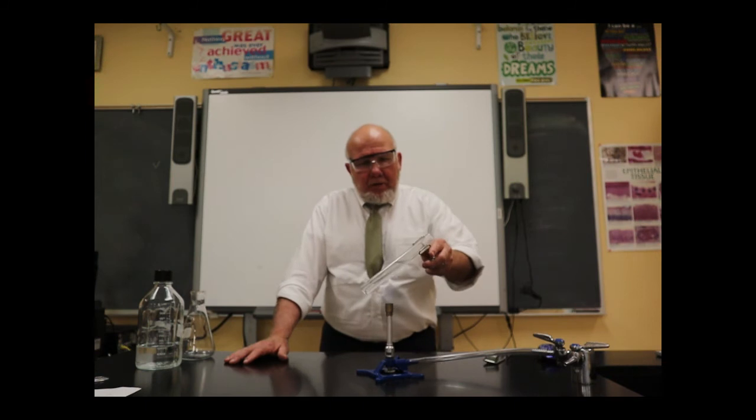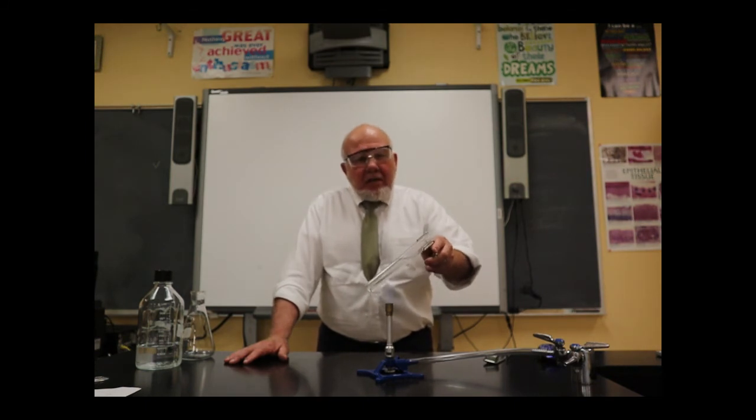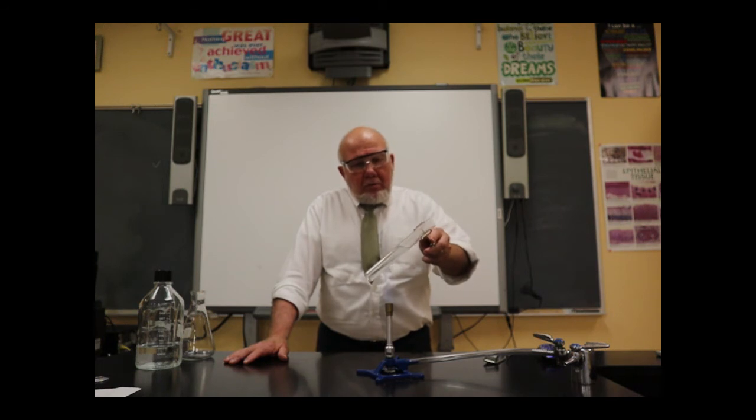Now, this is the tricky part. You need to kind of evenly heat it. You don't want to heat one side or one area too much because you don't want to create a big gas bubble that might blow liquid out of the tube. Sort of like when you're boiling water. You got your water boiling really heavily, going strong. Sometimes you get these big bubbles that burst and liquid splashes out of the pot.